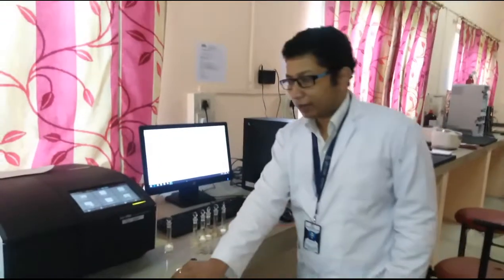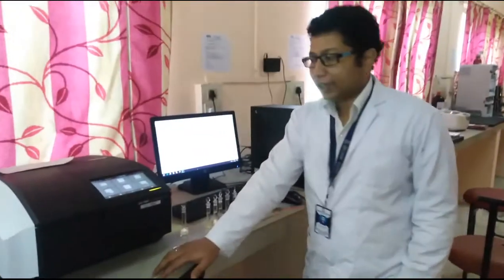So dear students, today we are going to demonstrate the last part of most of the practicals, the analytical section. For analysis purposes, the majority of the time we use a UV visible spectrophotometer. I will give you one demonstration of how to evaluate or analyze the final sample in the UV visible spectrophotometer. Let's come and see the demonstration.